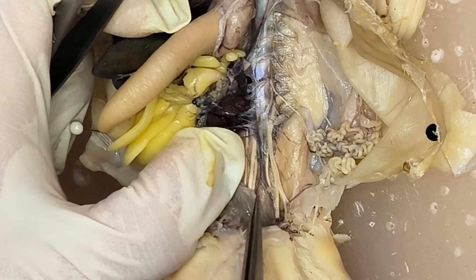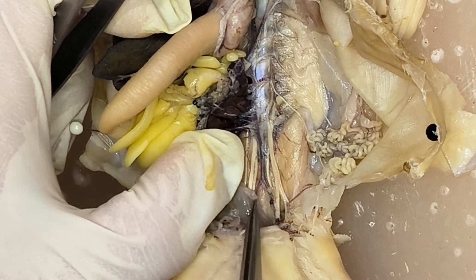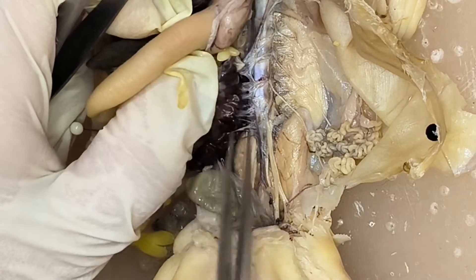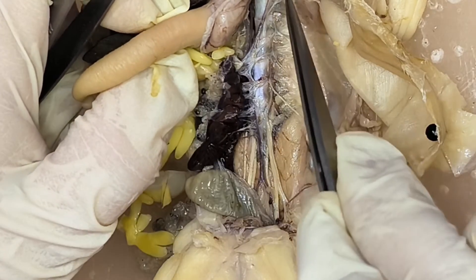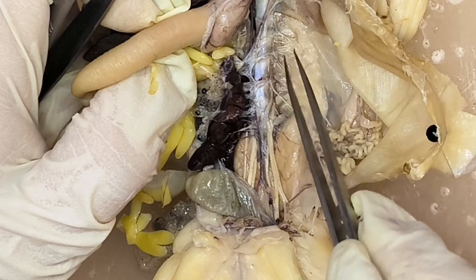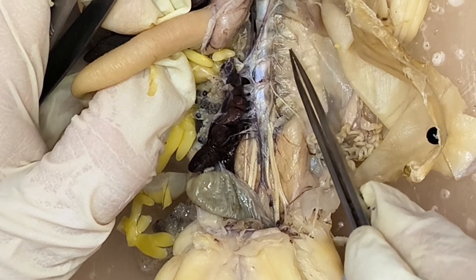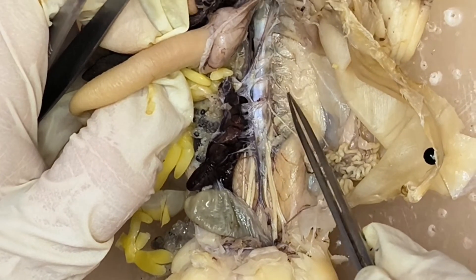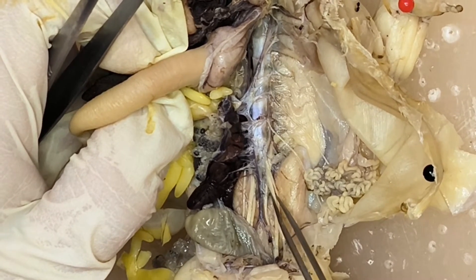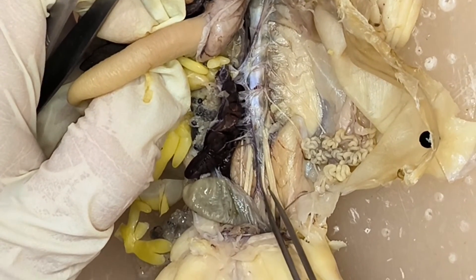The tenth nerve may not be visible here. So to summarize: you have the first, second, and third; then the fourth, fifth, and sixth; and then the seventh, eighth, and ninth spinal nerves.